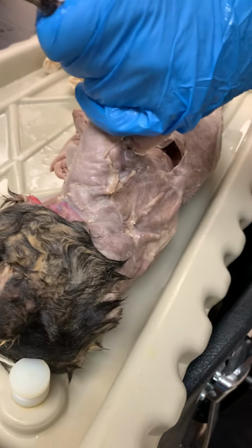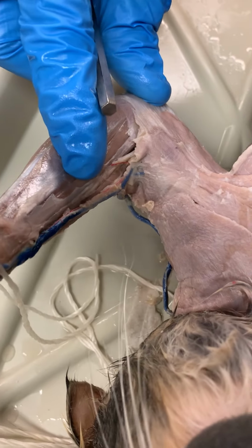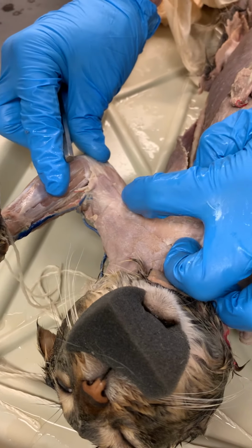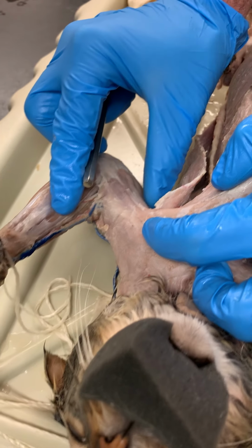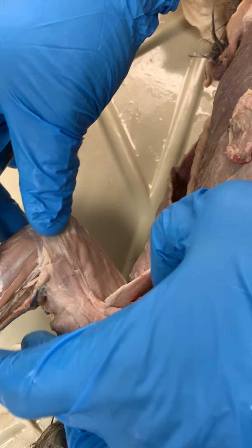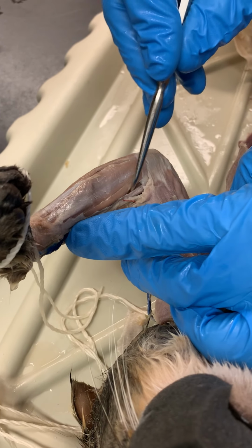All right, so we already saw this. Let's take a look at the deep one and the superficial one on the medial aspect. Not a lot here to see on the arm because most of it's still chest muscles. Clavodeltoid, pectoantebrachialis, and pectoralis coming in. There's our epitrochlearis. And of course, we'll cut that to show deep in a moment, but let's look at the forearm. We have four muscles here again.